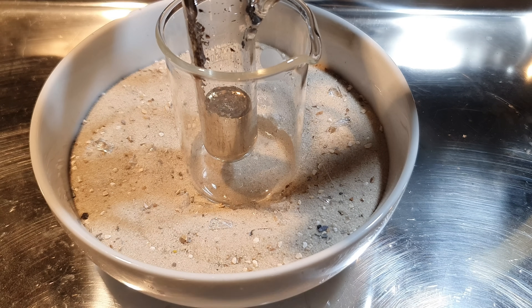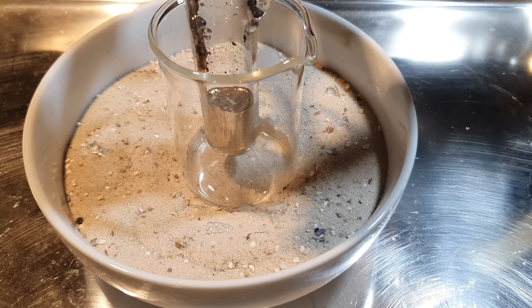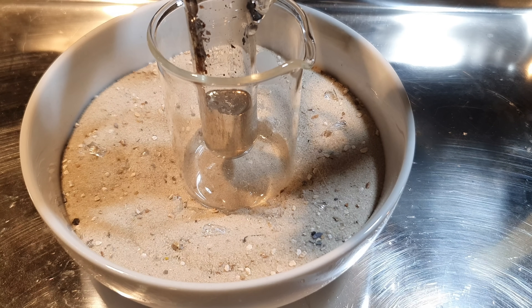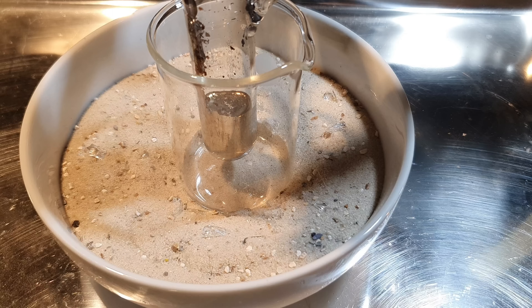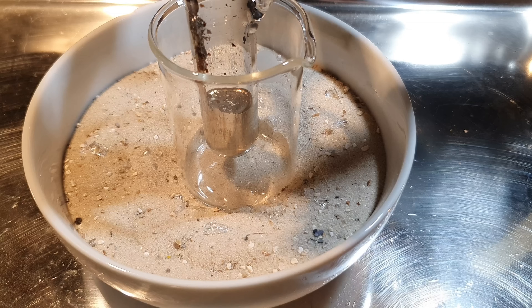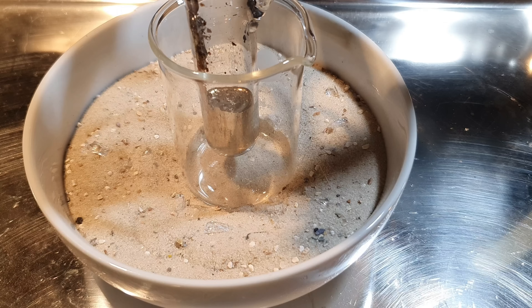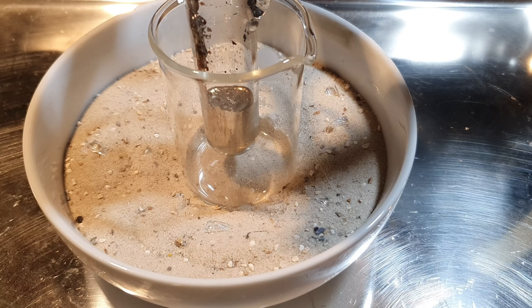It is pretty tricky to find a good angle for the camera. I'm going to now switch off the vacuum pump and then slowly introduce some oxygen — you will definitely see a change on the surface of the cesium. In the original paper, they melted all of the cesium. Mine isn't completely molten, but I think the reaction heat produced will melt the rest. For now I'm going to leave it and let only the surface of the cesium react with the oxygen.